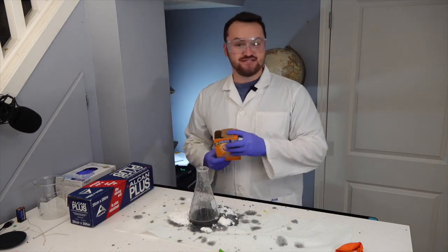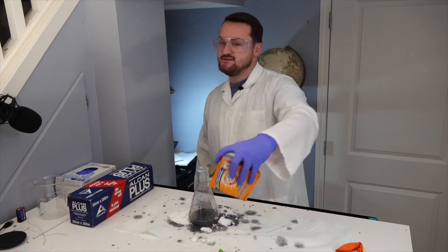As you can see, folks, even when you know what you're doing, you don't know what you're doing.